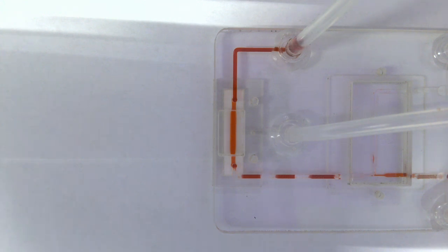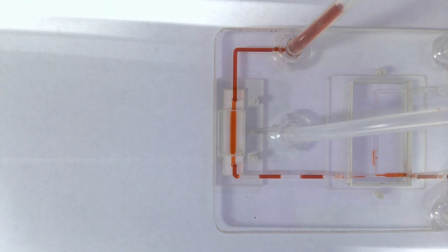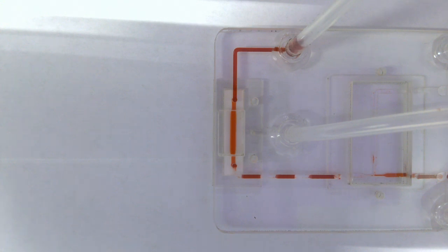And as the system keeps pumping the fluid and the air through, as it hits the Porex Virtek PTFE bubble trap, the bubbles are removed and pulled out by the vacuum, and the liquid remains bubble-free, which will then go to the optical or whatever downstream step does the final testing and evaluation of the sample. And as you can see, the Porex Virtek debubbler is working extremely well. No air is passing beyond the bubble trap, and it's completely free of bubbles, which makes detection of that stream very, very easy and accurate.